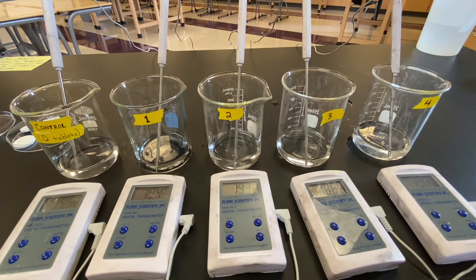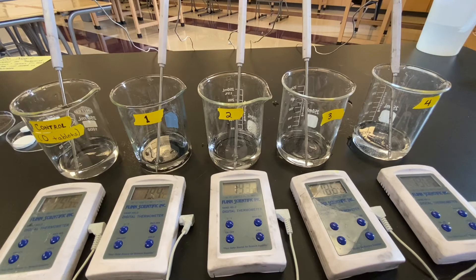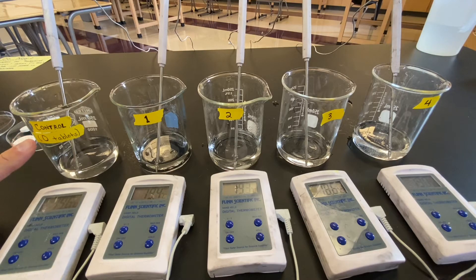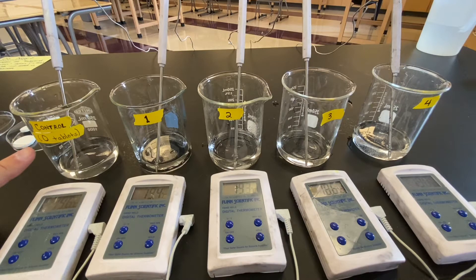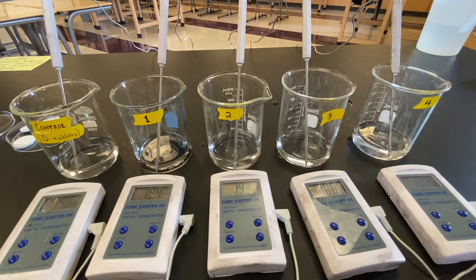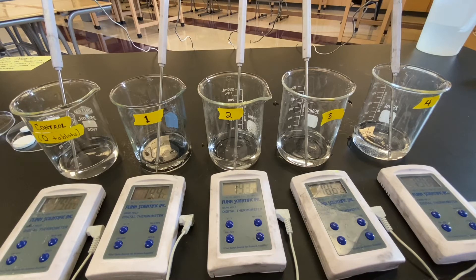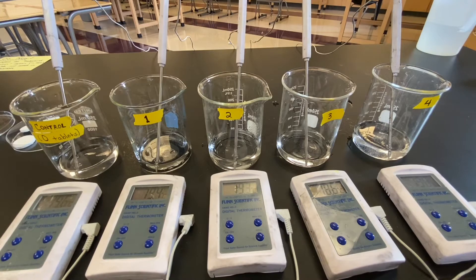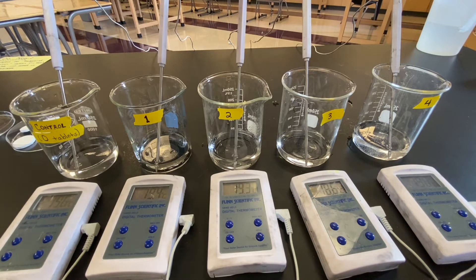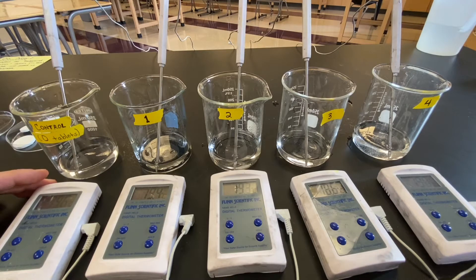What you see here is the setup for our lab. Our procedure has us setting up five different beakers. I've labeled the beakers by the number of tablets that we plan to put into each beaker. Zero is zero tablets — that's our control. We need a control because we want to know that it's for sure the amount of tablets affecting the temperature of the water. If we don't add any tablets to this one and the temperature doesn't change, then we know it's for sure the tablets affecting the temperature of these waters. We're isolating this to make sure we know it's just our independent variable — the number of tablets — affecting the temperature change in the water. There's also a different thermometer in each beaker measuring the temperature as we add the tablets.